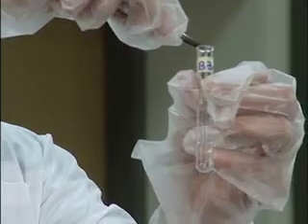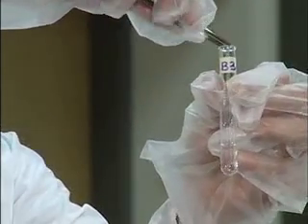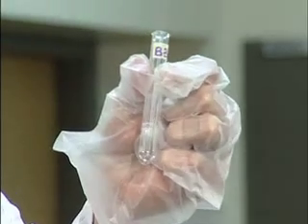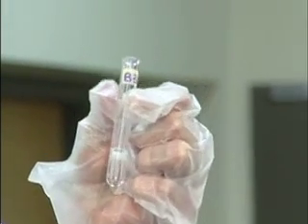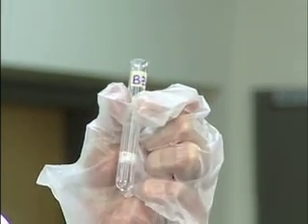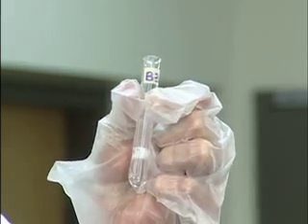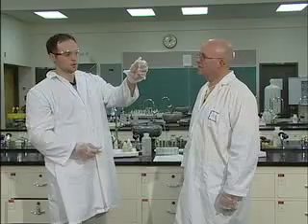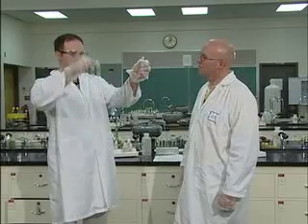When we put the magnesium into the hydrochloric acid, you hear a reaction, you see a gas forming. I see smoke. It's going nuts in there. You'll also notice, if you were able to touch it, a temperature change. So you saw a gas form. We had a reaction happen.